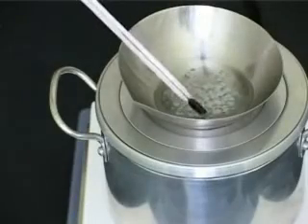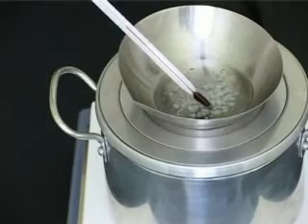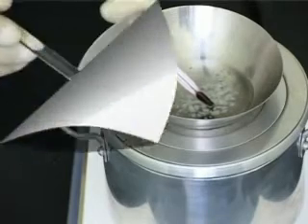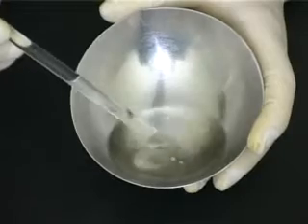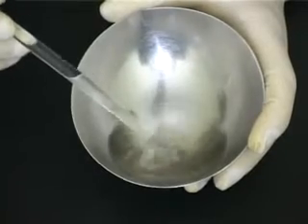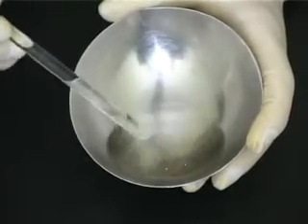Check the temperature and remove the evaporating basin from the heat. Some solid will still be present, but the residual heat should ensure that it melts. Stir to assist melting of the remaining solid.